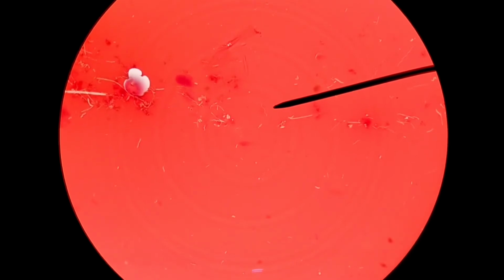Doesn't necessarily mean disease. So here we have a spirochete at the end of the pointer, and so you got a good look at that. This is likely the type of image that you would see on a practical exam, or if you were a clinician looking at someone's clinical sample, this could be an important finding.